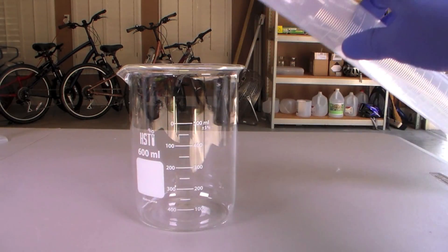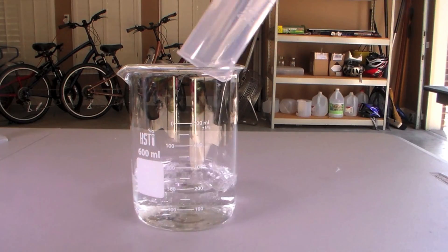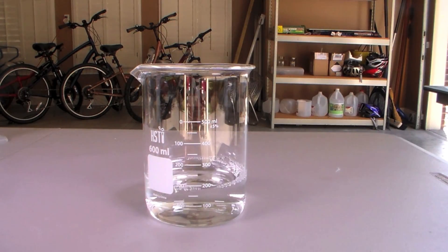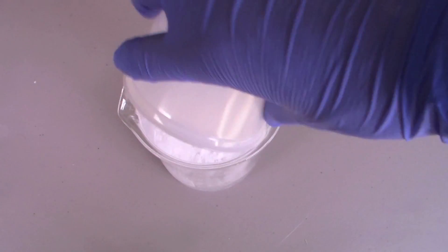Then the 40 grams of boric acid was added to the water.